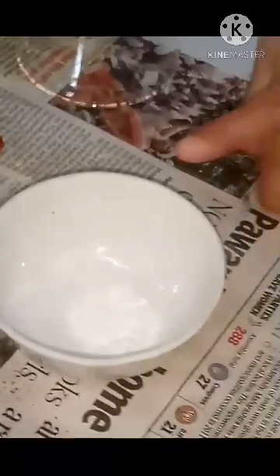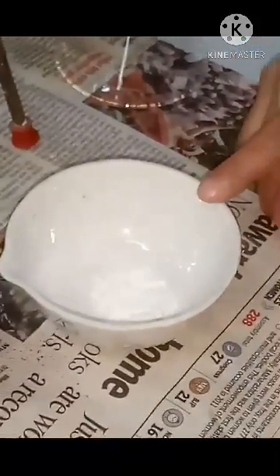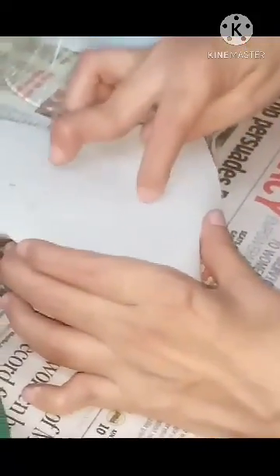Now we have to cover this porcelain dish with filter paper. We have to make a number of holes in the center part of the filter paper. For that, take the filter paper and place the glass funnel on it, then draw a circle using a pencil or pen.